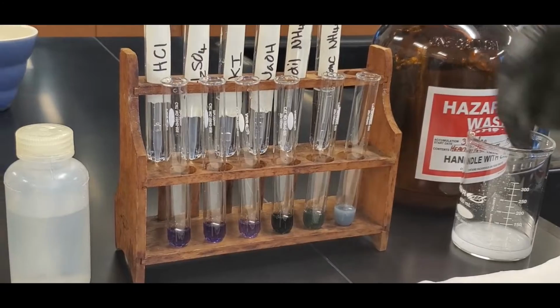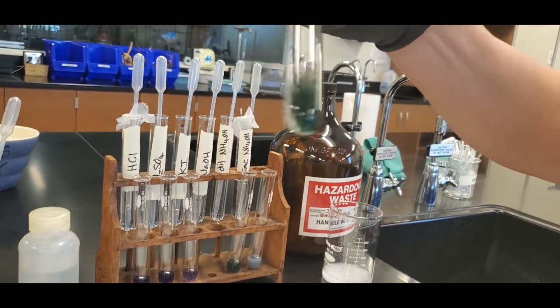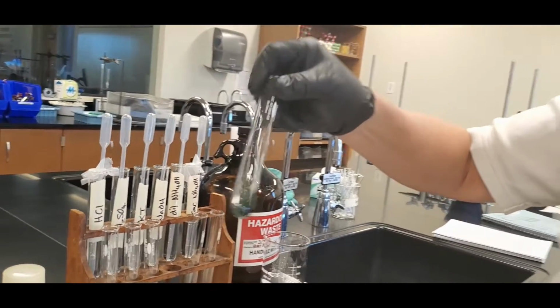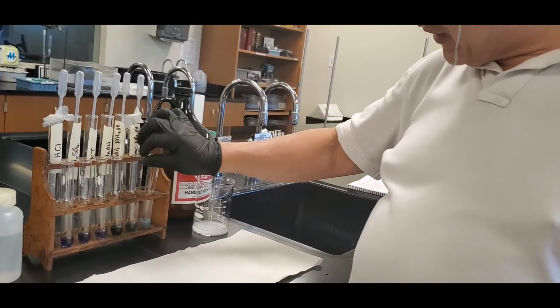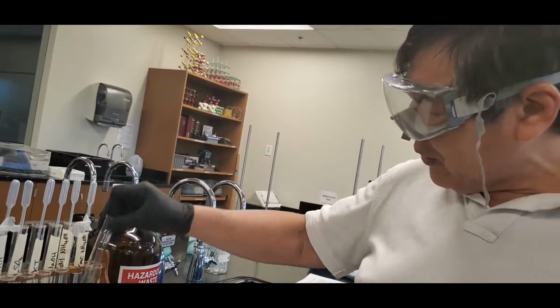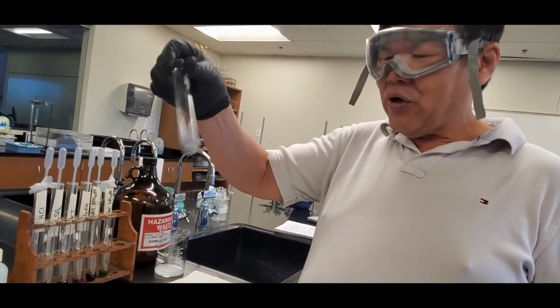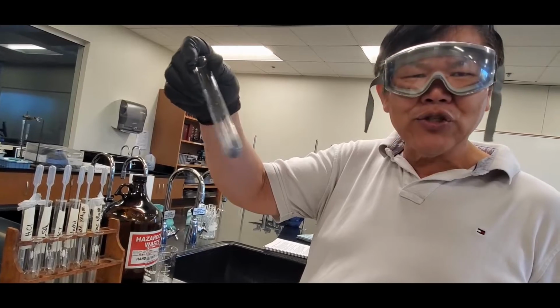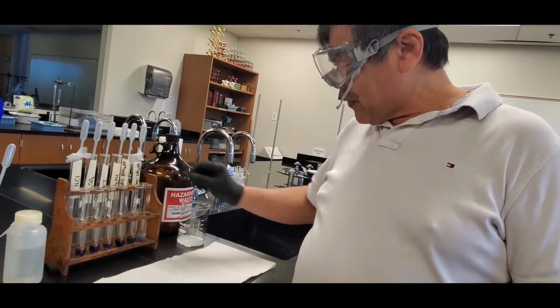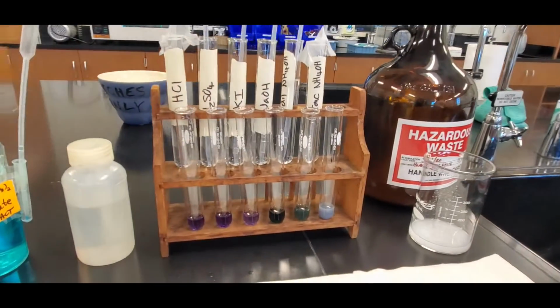Now, what I want you guys to notice is the one with the sodium hydroxide. It's solubilized. Look at it, olive green. Yes, kind of olive drab, whatever. And then the dilute is sort of like that, but it's not so deep in color. And of course, look at the concentrated ammonium hydroxide. Ew, it looks like that god-awful green pea soup that Mom used to make. Anyway, let's zoom in, and then I'll take a picture of it later for you.